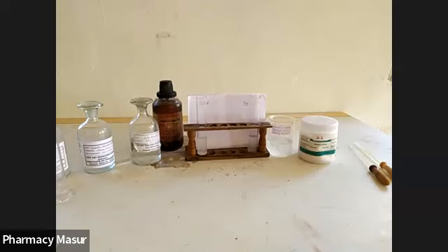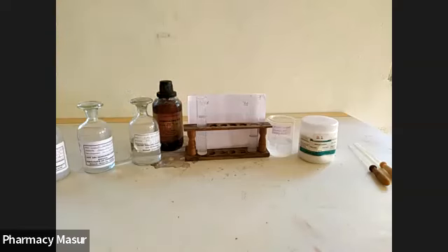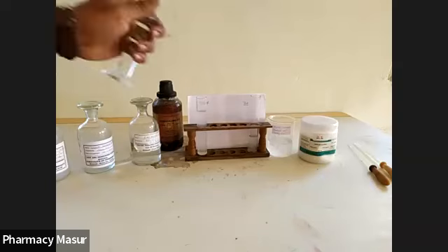So far we have added 1 ml of barium chloride and 1.5 ml of ethanolic sulfate. Then keep it aside for 1 minute. Then we added 15 ml of sulfate standard and test in the standard and test solutions respectively. After it, some acetic acid. So a total of about 17 to 18 ml of solution is prepared. Now we want to make up the solution up to 50 ml. So this is 25 ml. This is 7 ml. So this is nothing but a total 50 ml volume. The same volume should be adjusted for the test as well.